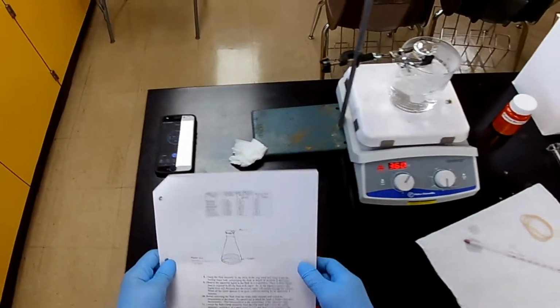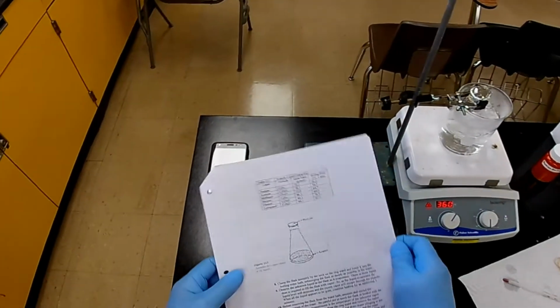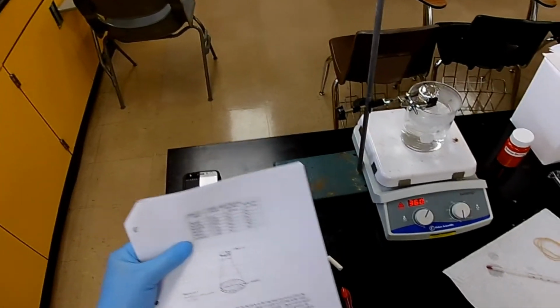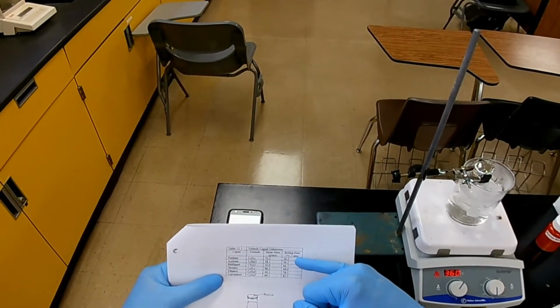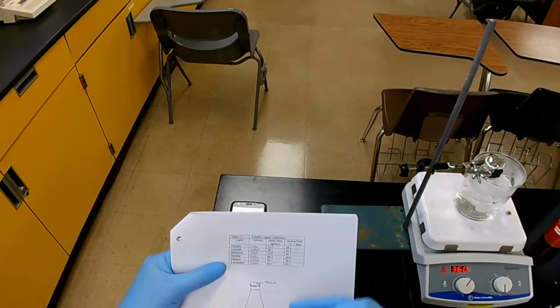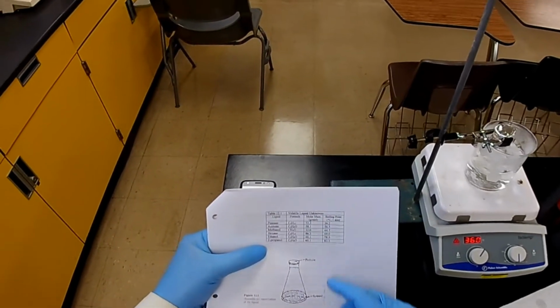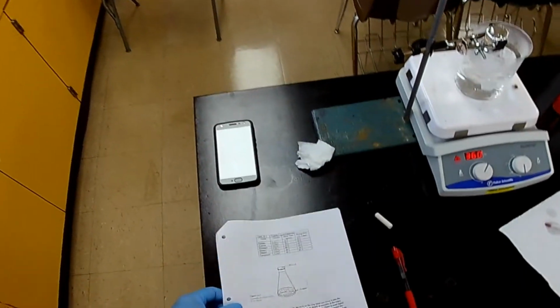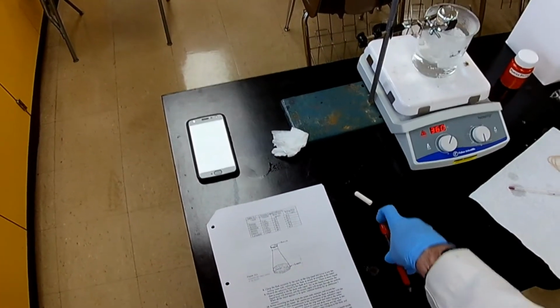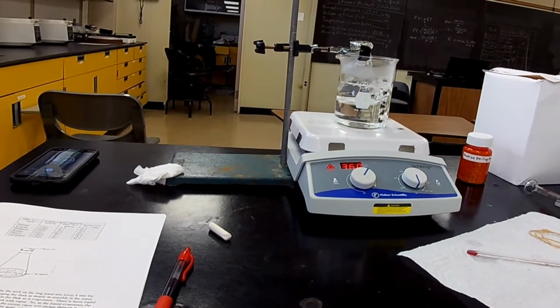So here are the different volatile liquids that I have to choose from, and we picked number 4. The first thing you notice is all the boiling points of these liquids are less than 100 degrees, actually less than 90 degrees, which is good. Then we're going to determine the molar mass using this procedure and try to match the molar mass with the liquid, the particular compound. Okay, about another minute. All right.